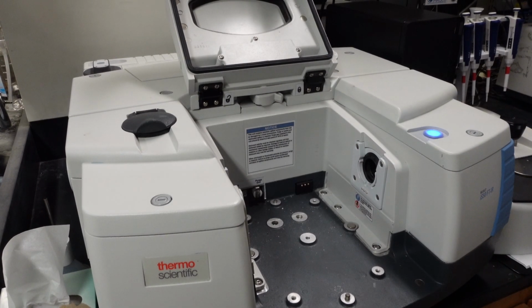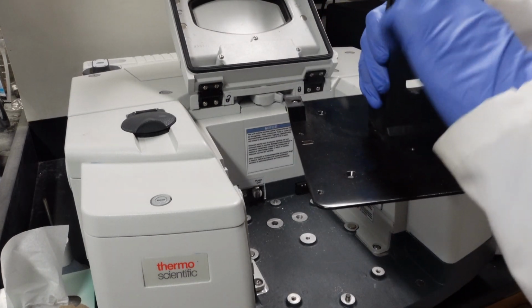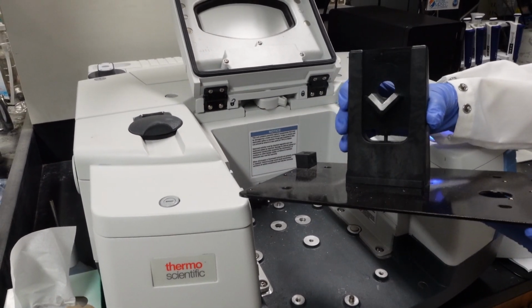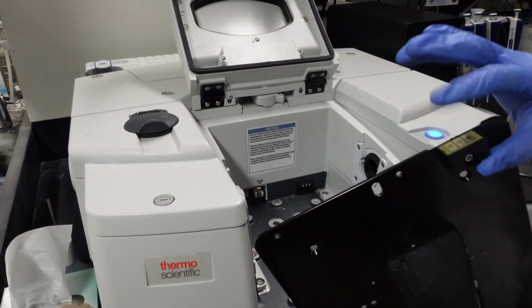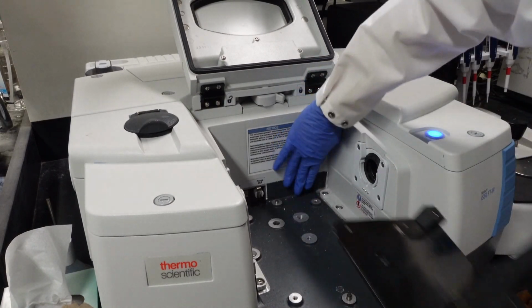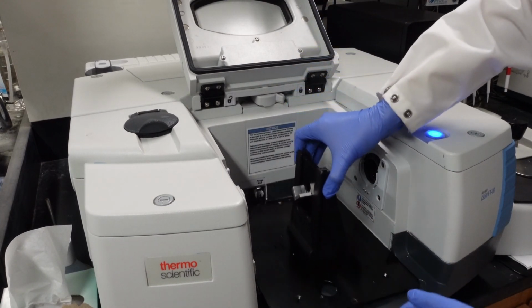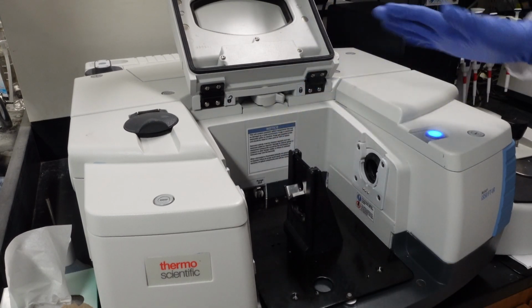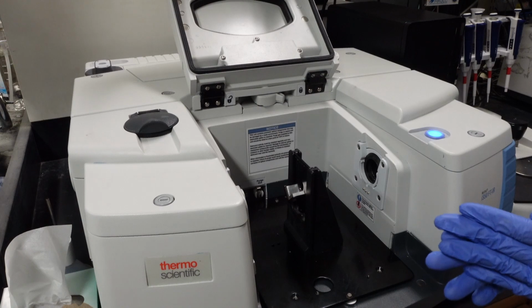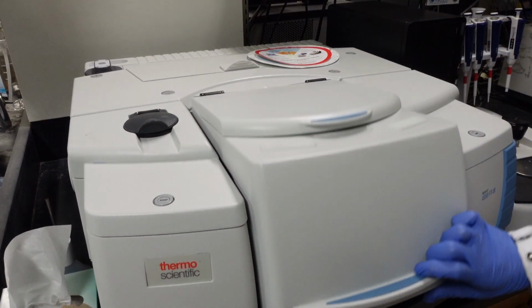for it. And so to the right of the computer, if you want to grab this, this is for transmission mode. You can put a glass slide on it. And then you just want to make sure that all the pieces line up. So there's a connector here that aligns. Then you can just lower it, and it should connect in and feel pretty sturdy. And then when you're done, you can close this up.